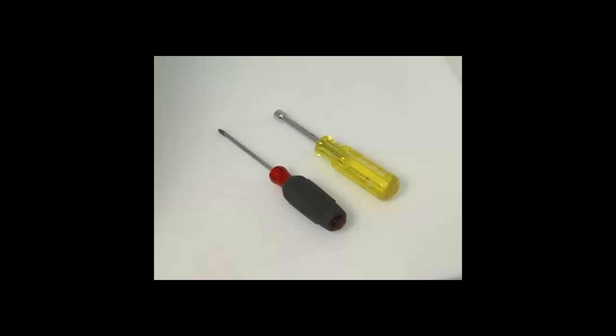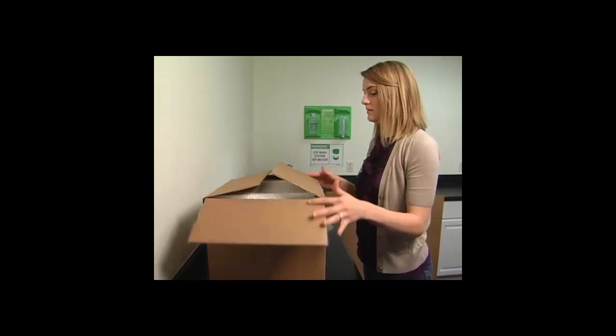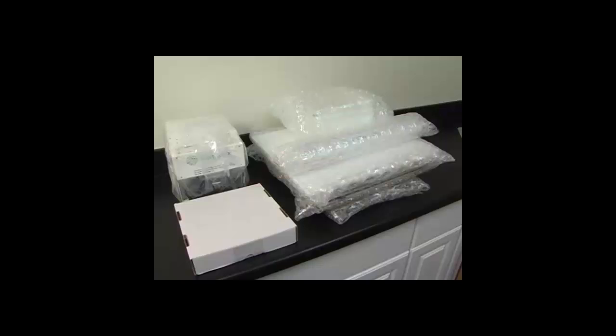For your convenience, we have created this demonstration assembly video to help you ready your unit for operation. You will need a Phillips head screwdriver and a nut driver to assemble your hood.